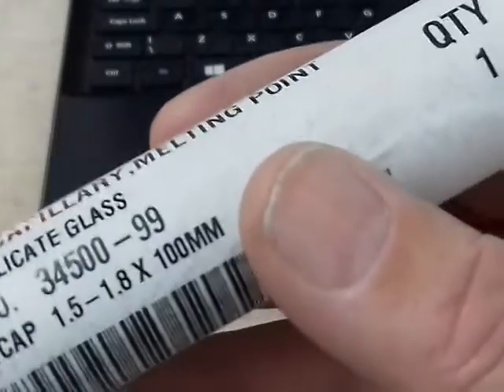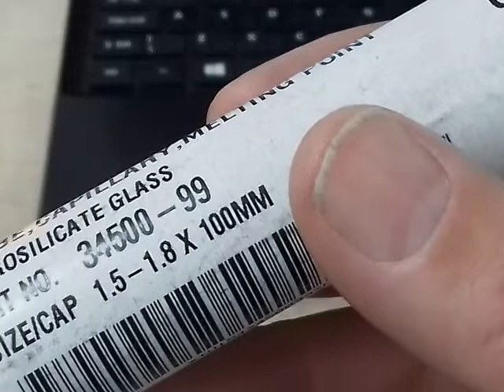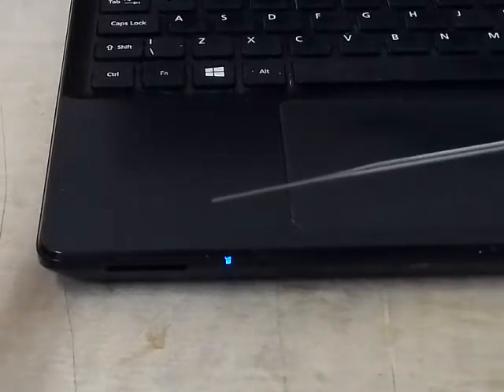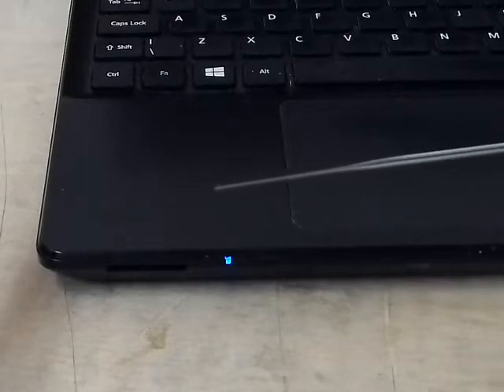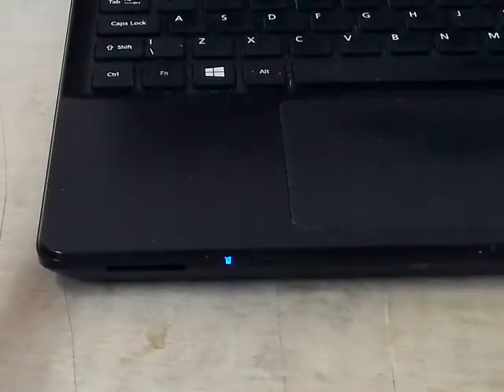Ideal size for me is about 1.4, 1.5. So if you look around, you'll find the sizes that are available. They all vary. I'll show you another very fine point. That one there has probably got a point of about 0.15 to 0.2 of a millimetre. It's not that hard to do, you just need to take your time, and practice makes perfect.